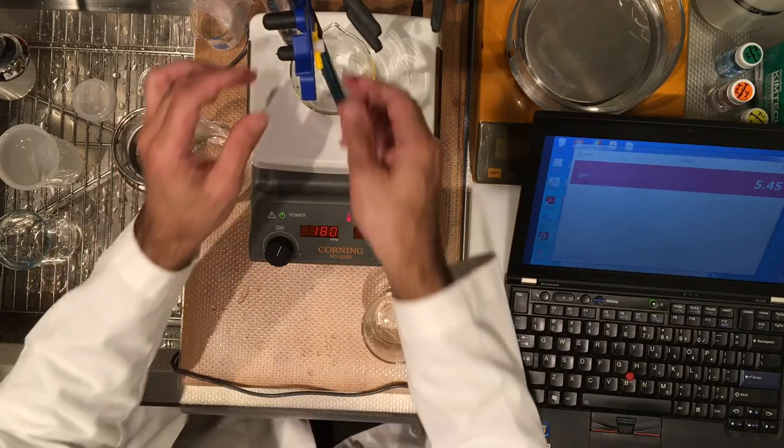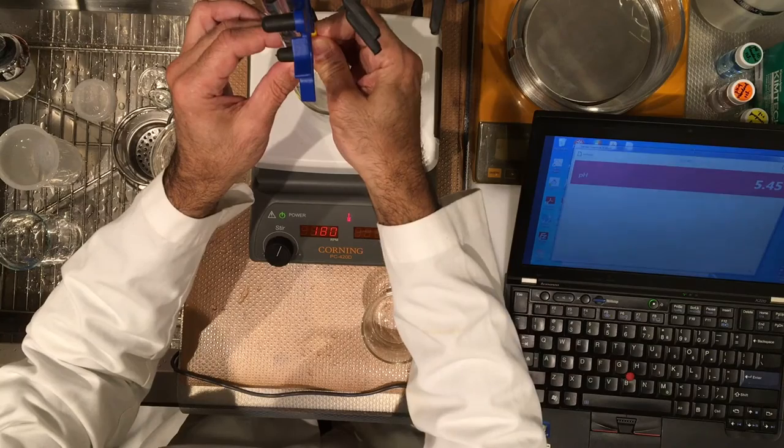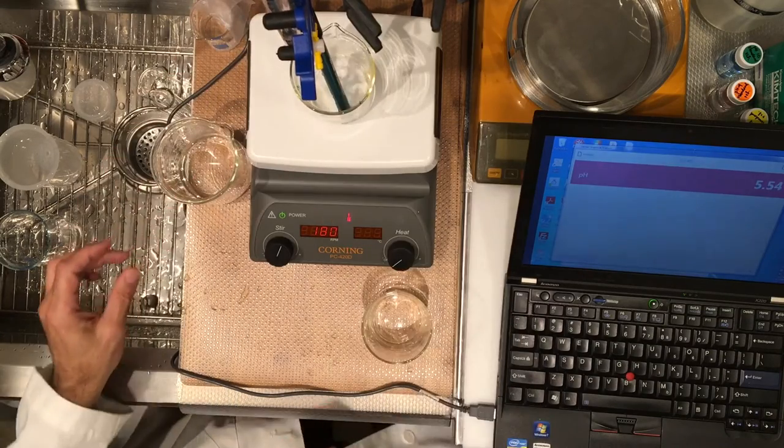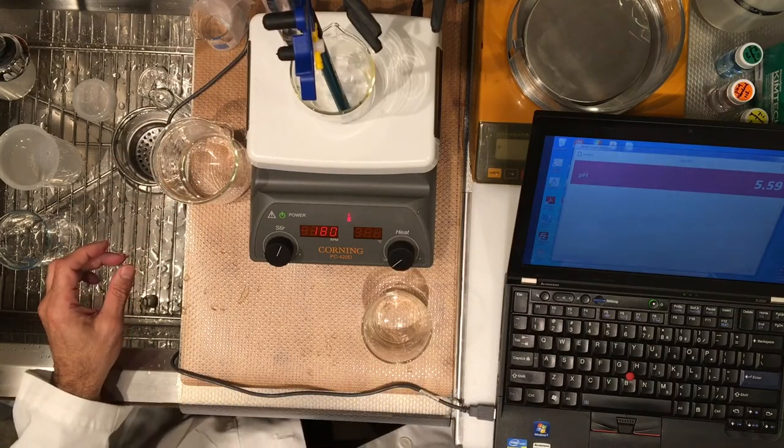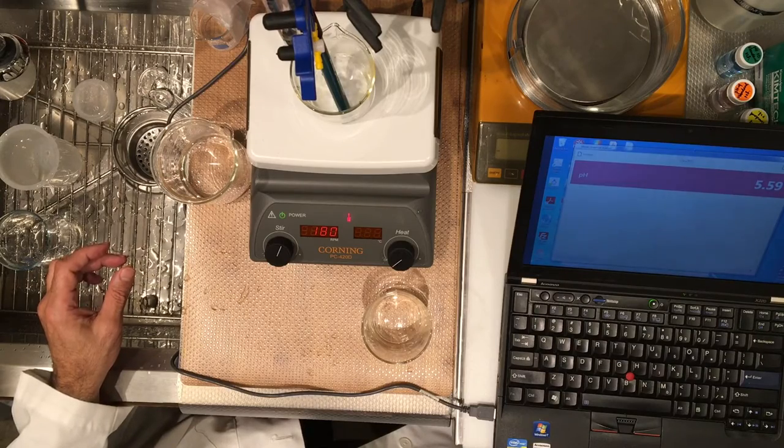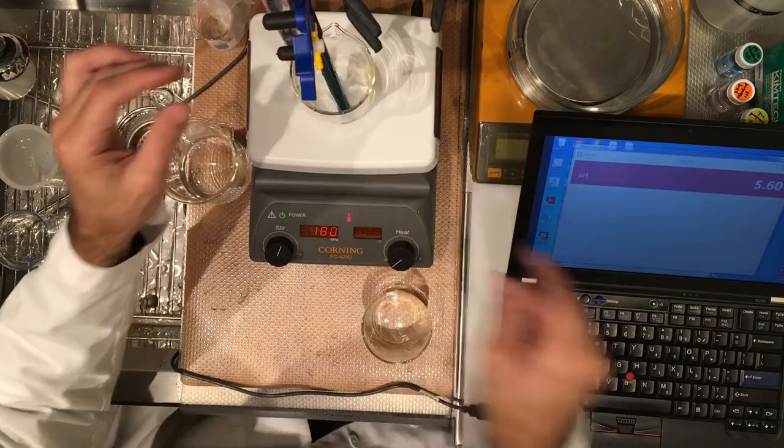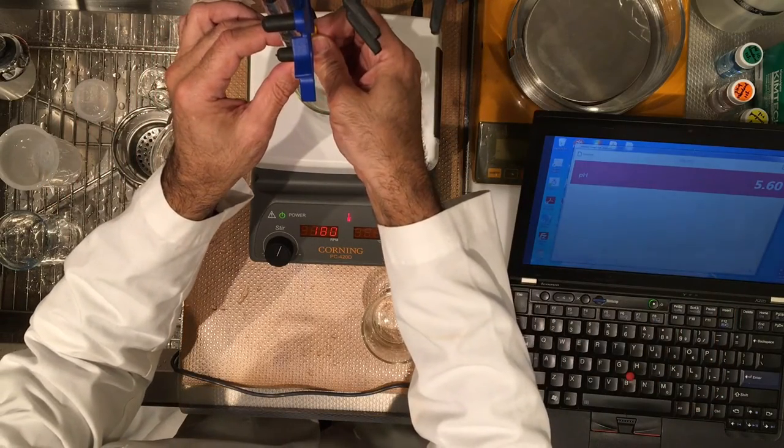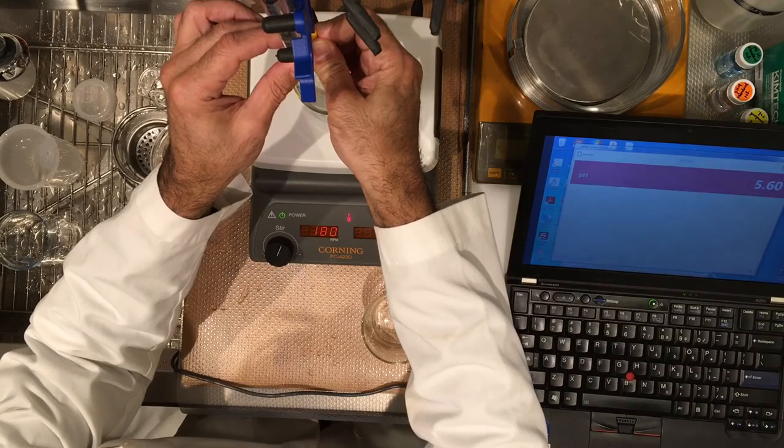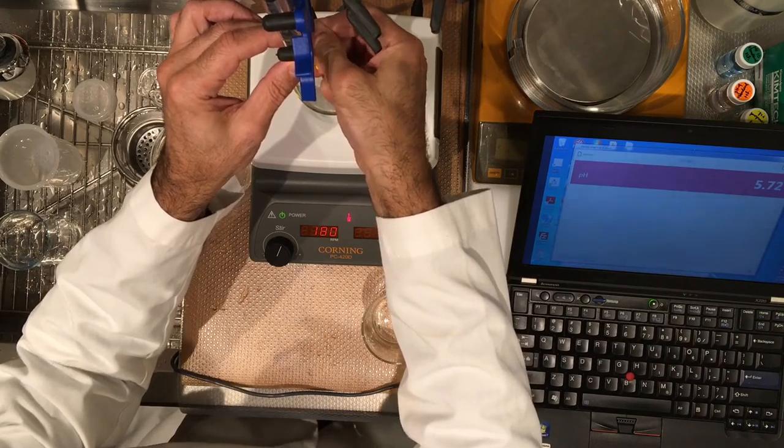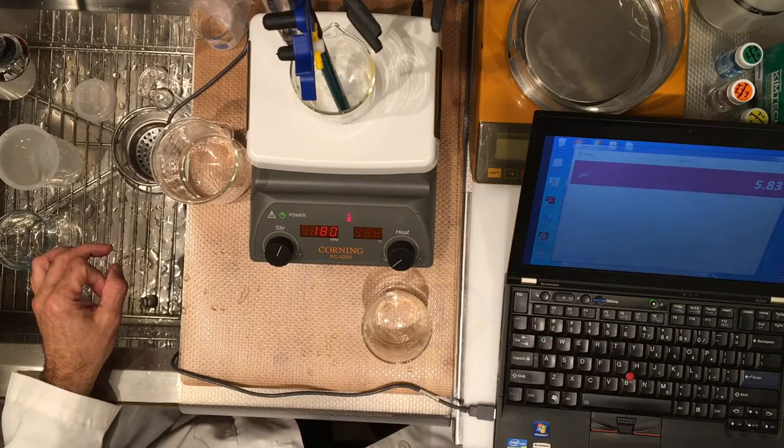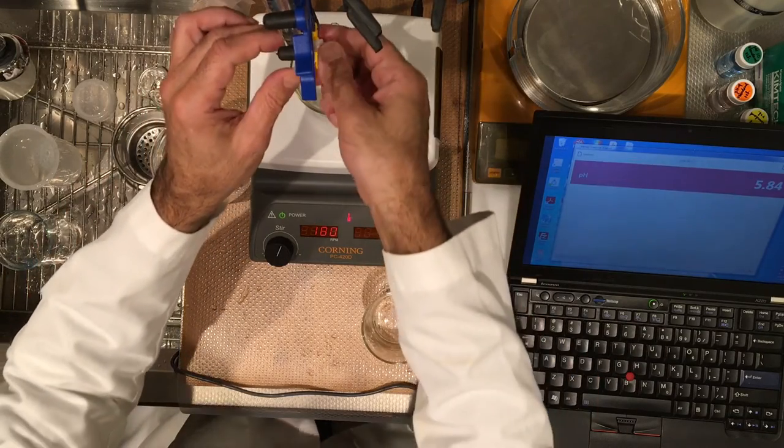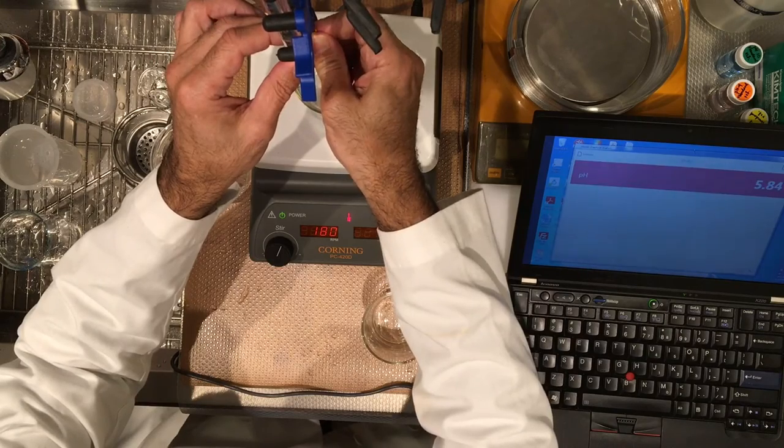Record 9.50. Now next time I'm going to go to 10.7. Make sure I don't miss the end point. So record this 10.70. Now I'm going to go to 10.90.